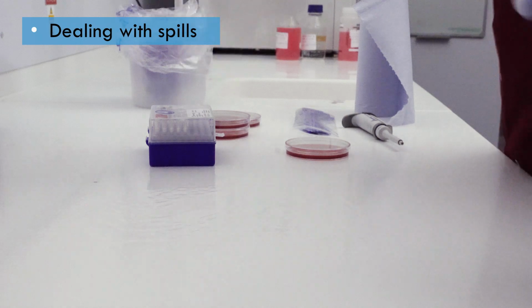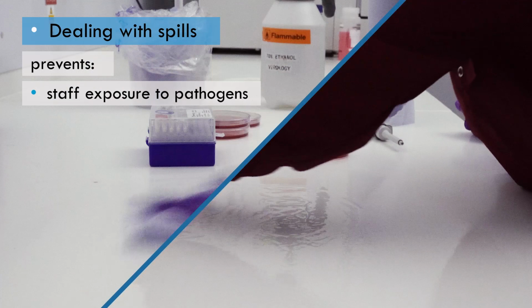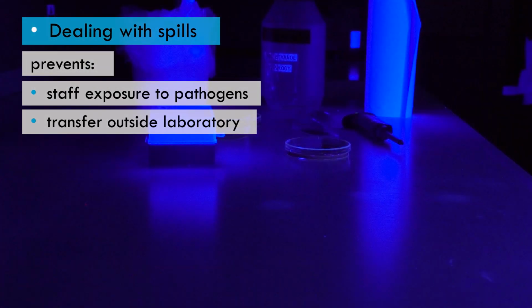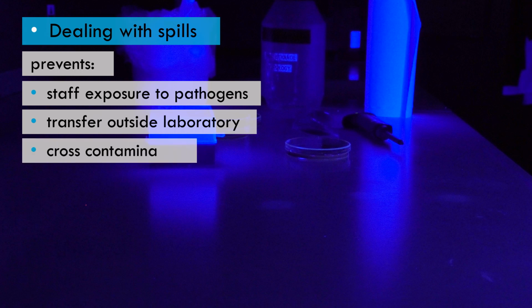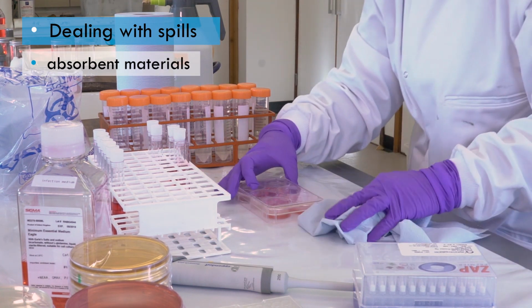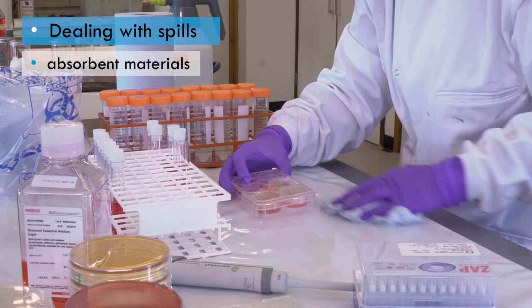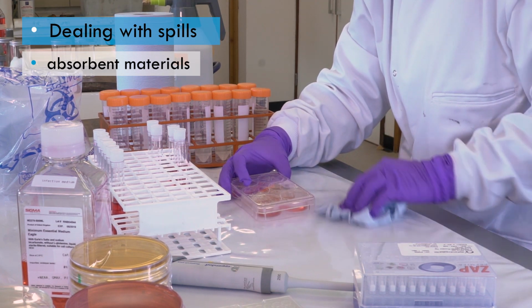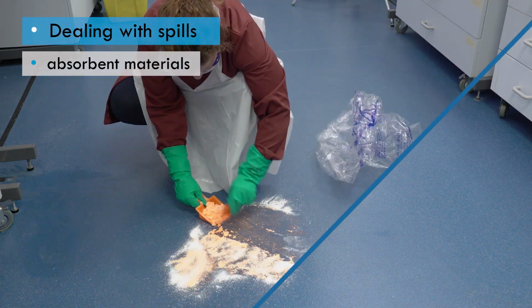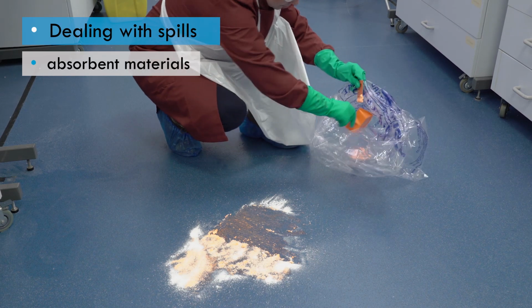Working like this should ensure that you prevent staff being exposed to the spilled biological agents, transfer of the biological agents outside the laboratory, and cross-contamination of samples. The spill should always be mopped up and removed using absorbent materials such as disposable paper towels or gel preparations. These materials can then be decontaminated by autoclaving, incineration or disinfection before disposal.